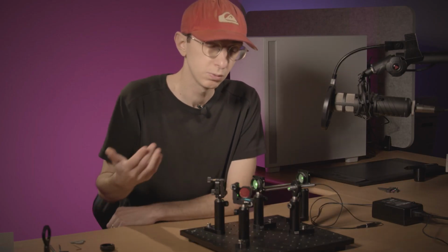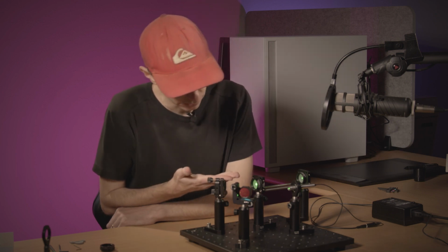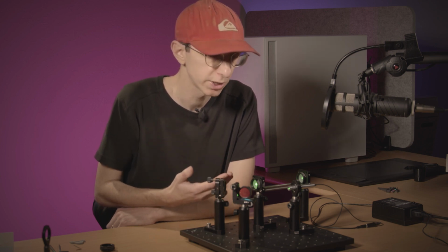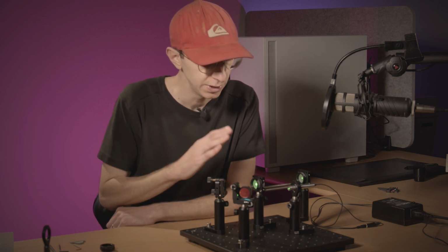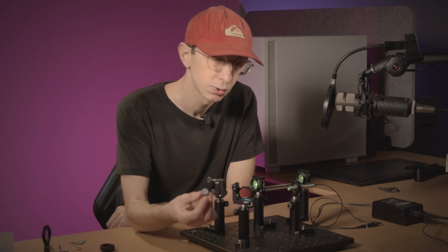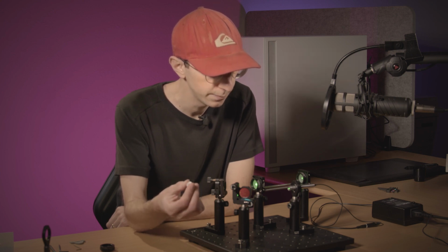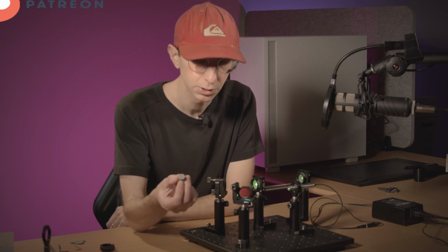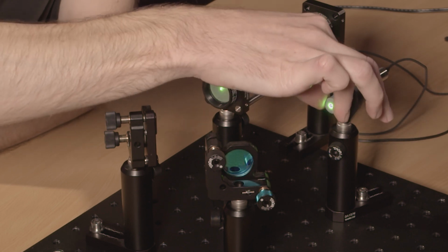So you see that one issue that you may face is your laser beam being way too large compared to the aperture you're passing through. And it's basically impossible to do any kind of precision work. And I think most people who have issues with the starter edition of the Open Raman spectrometer, it's because of that. And for that reason, I made these auto-centering sleeves with a 1.5 millimeter diameter aperture on top of them. You can download them on my Patreon page if you're a premium member and make them yourself using any kind of 3D printer. So I will put this aperture on top of the laser.